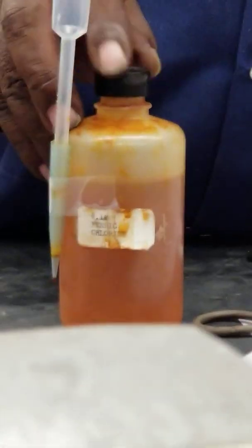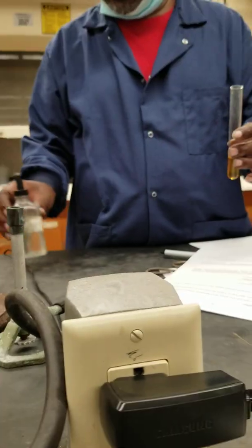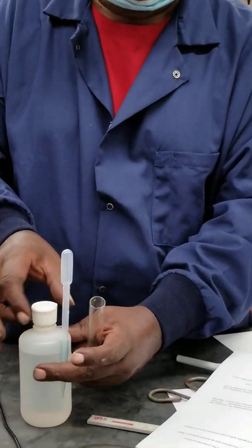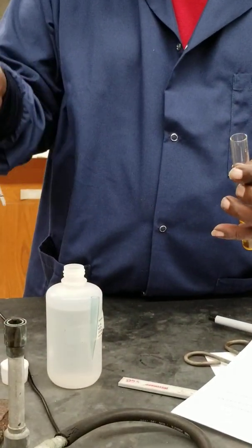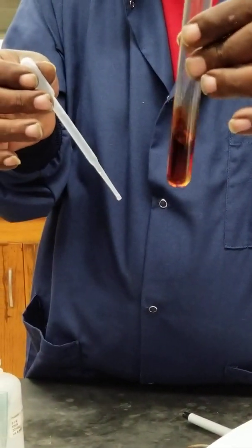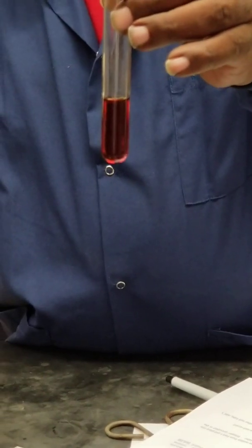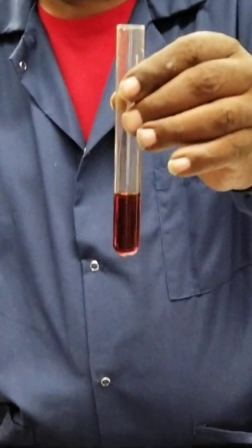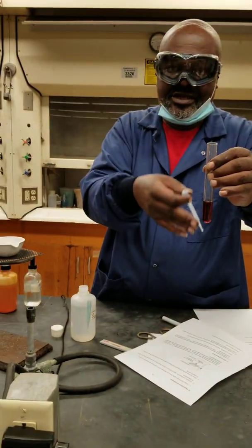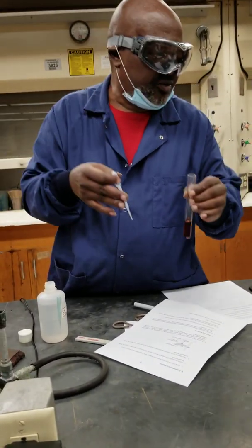Make sure that you're adding the right reagent. It says add potassium thiocyanate. In the near future, you'll know the exact chemical formulas of these reagents. Look at that. You can then look at that and make your obvious observations. In this case, the proper description is: this solution is colorless — whatever the color of the original iron-3 solution — and then the final color. I'm going to describe all those.